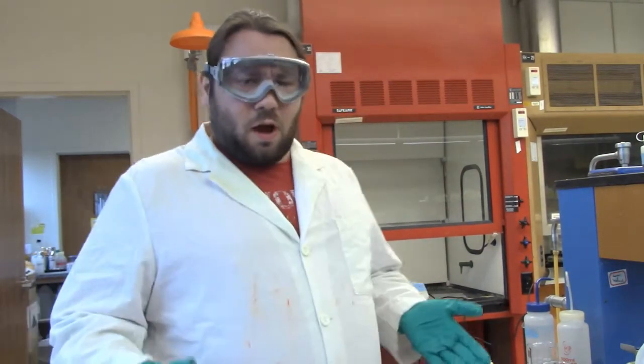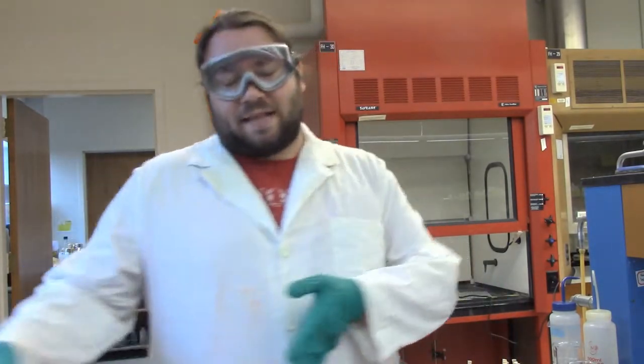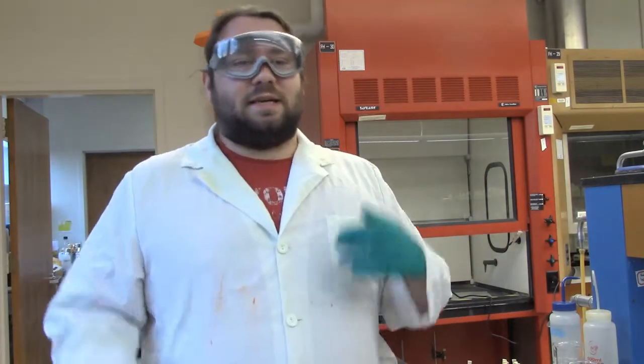Since you saw in the previous two videos me doing pretty much every single step, I'm not going to record myself doing every single step. I might jump here and there and say we've done the past couple of things, but you will see every test for every single cation. So your job is to say, hey, that turned the same color it did in the previous video, it must be in there, or alternatively, that didn't turn the color it turned in the other video, so it must not be there. And that's what we're grading you on.